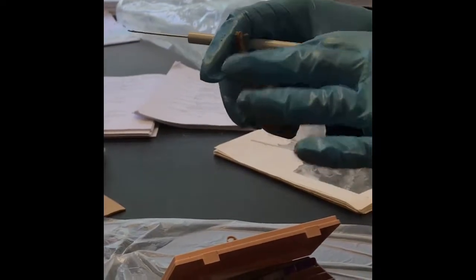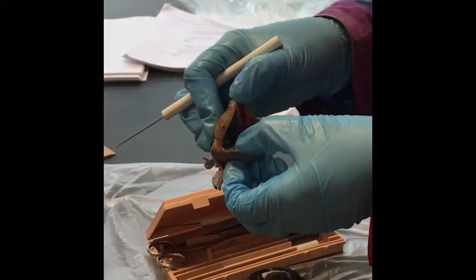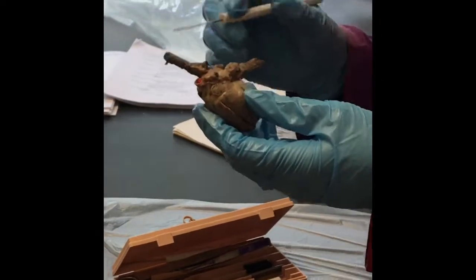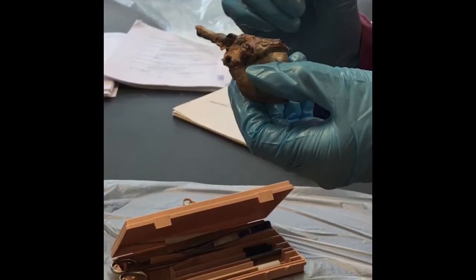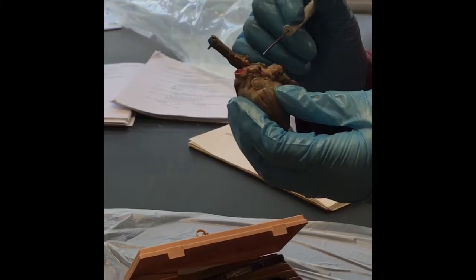Both of these are going to dump into the right atria. From the right atria, it's going to go down to the right ventricle. See, it's all blue on the inside. Deoxygenated. From the right ventricle it is going to pump blood out, and the only place you're going to see this is on the back side of the heart, the dorsal side, okay, through what we call the pulmonary arteries.